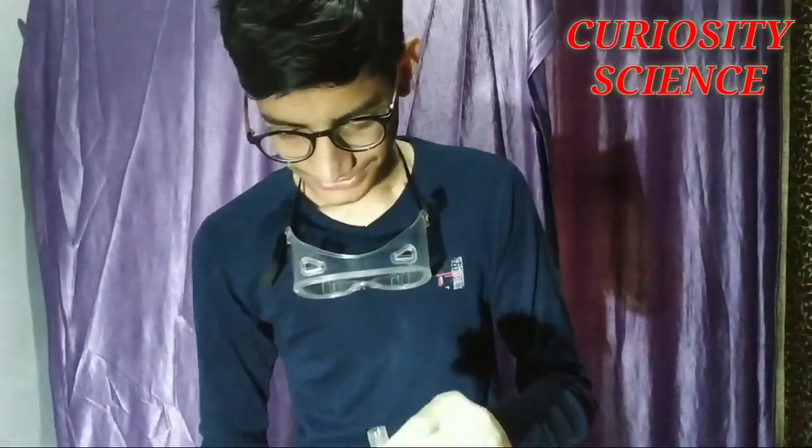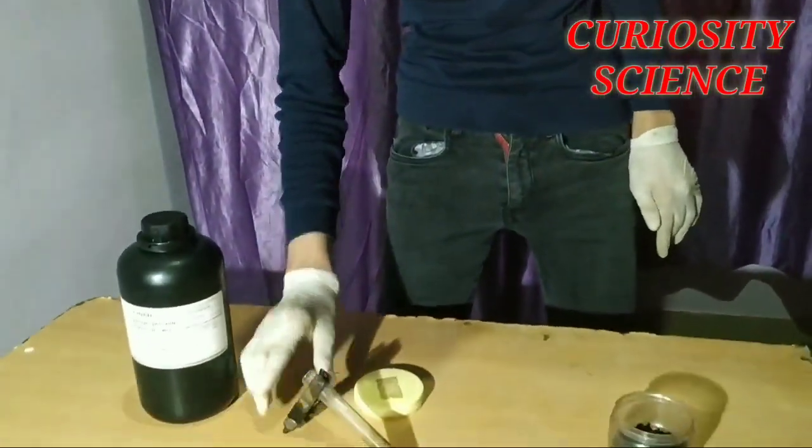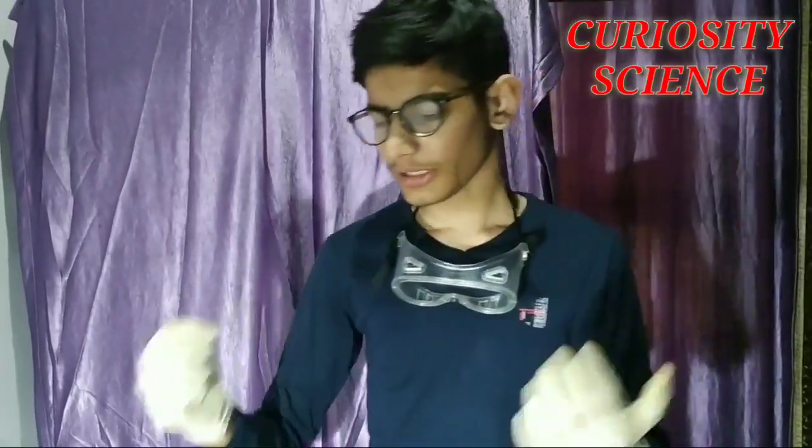Let's see how many amazing reactions we get. Hydrogen peroxide is a very unstable compound; its formula is H₂O₂. It is a very unstable compound — normally if you keep it in light at room temperature, it will decompose on its own, releasing oxygen. So this is a highly unstable compound.